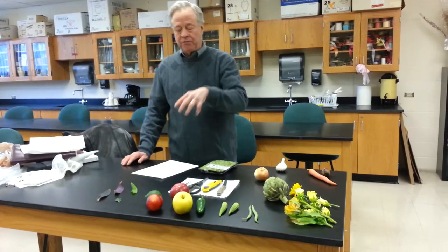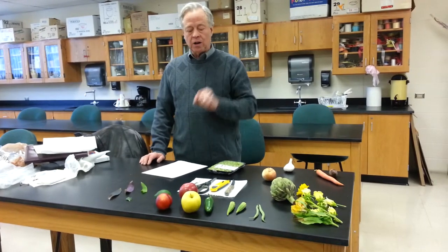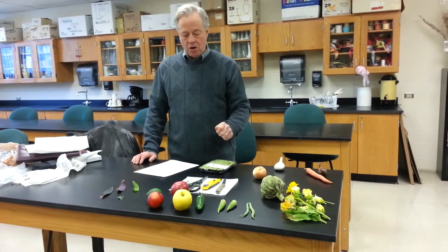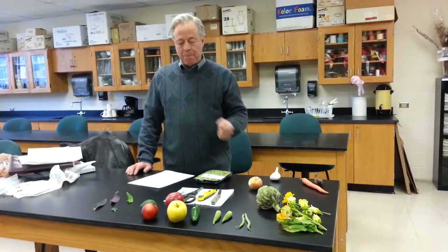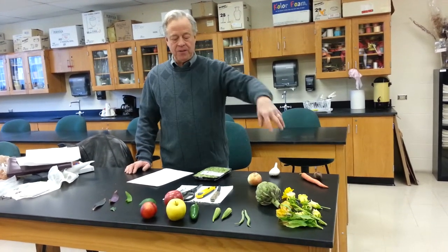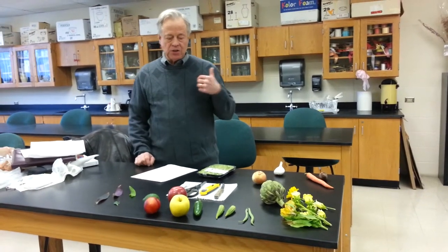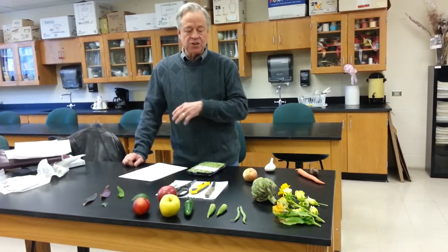So we're going to talk briefly about how to dissect. Once we do, you're going to do this at home and draw five pictures with labels of five of these classes of plant organs, and then you're going to send them to me as described in the assignment.